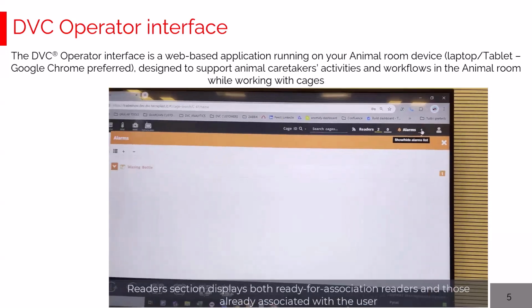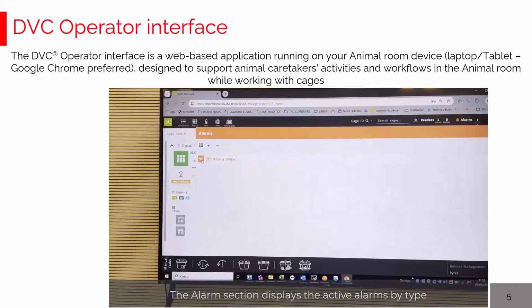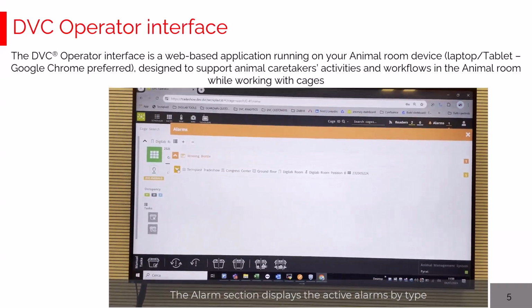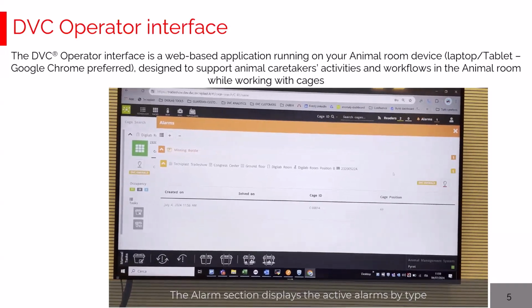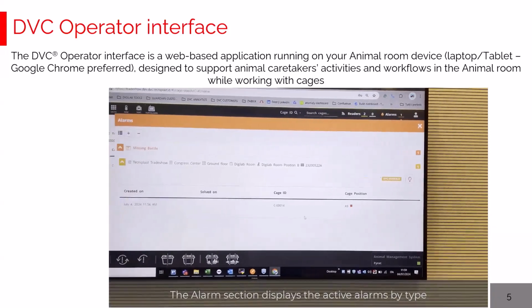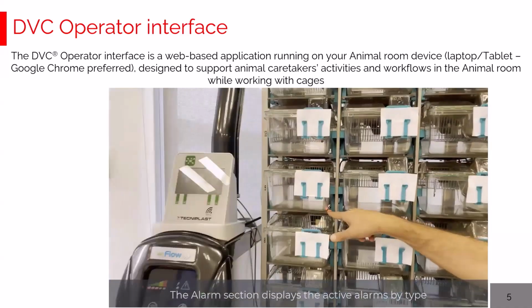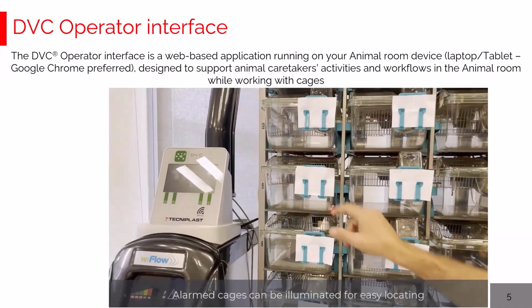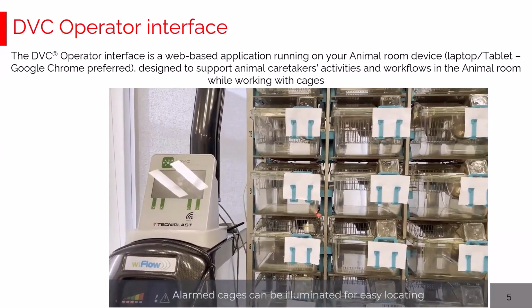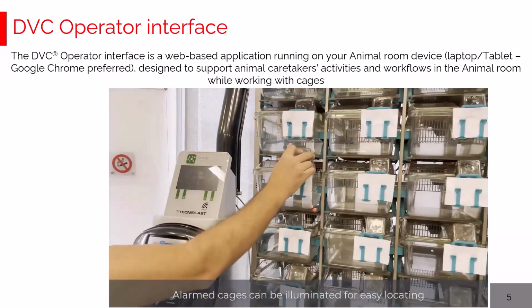Alarms: by clicking this button, you can see the current active alarms. In this case, there is one cage with a missing bottle located in this position. You can again illuminate the corresponding cage by clicking the LED, and here it is. How to solve the alarm? Very simple. In this case, you have to insert the water bottle.